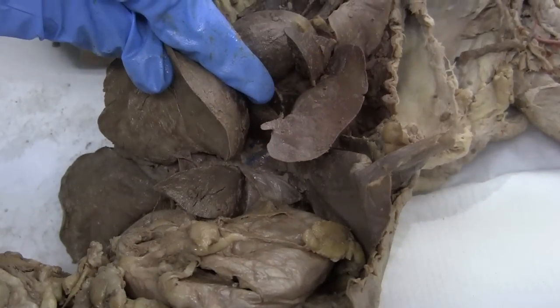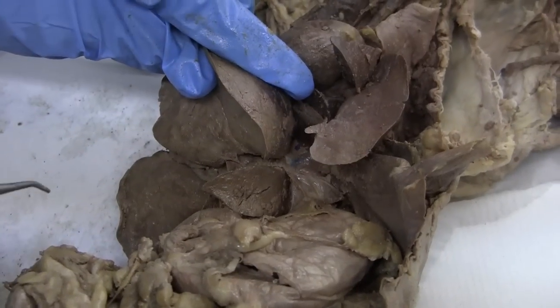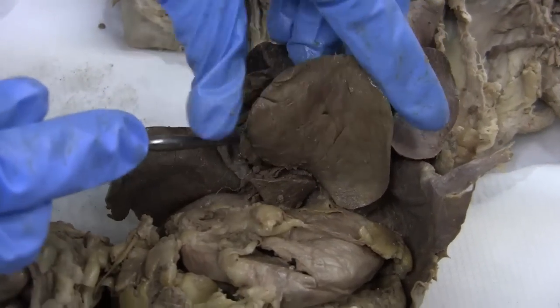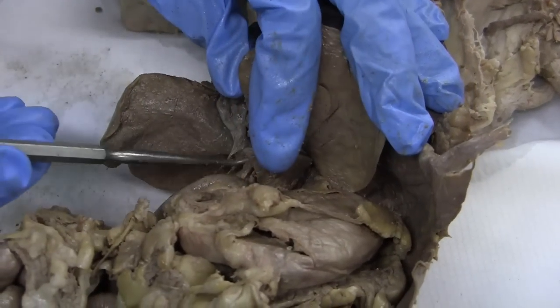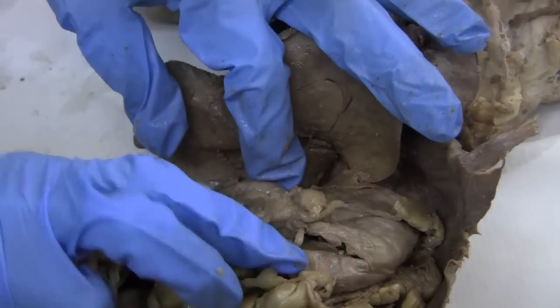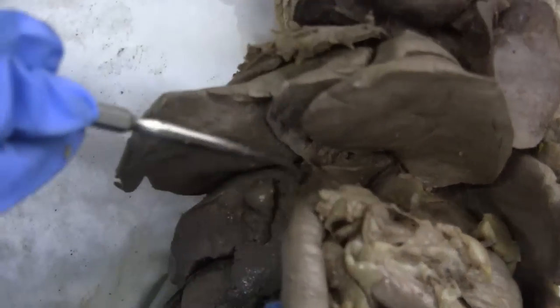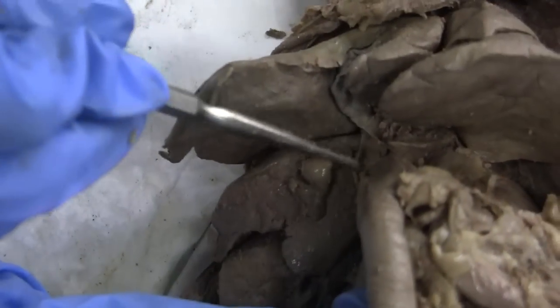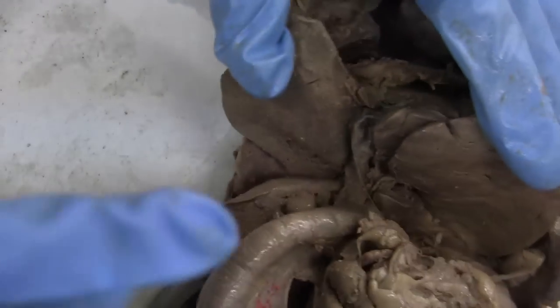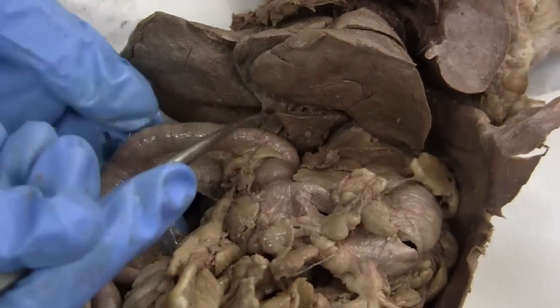I thought that's the esophagus. No, the esophagus — that's the gallbladder. Then the common bile duct is here, because that flows into the duodenum. So it's here. Yeah, then it's right there. And that flows into the duodenum, which is this.